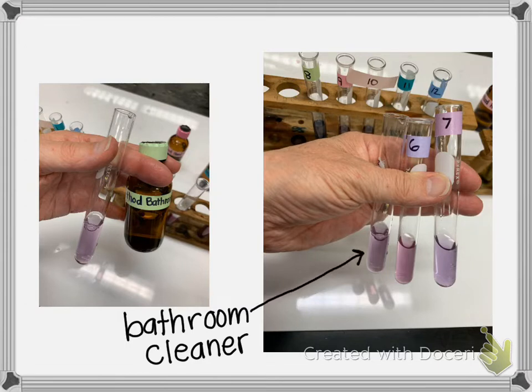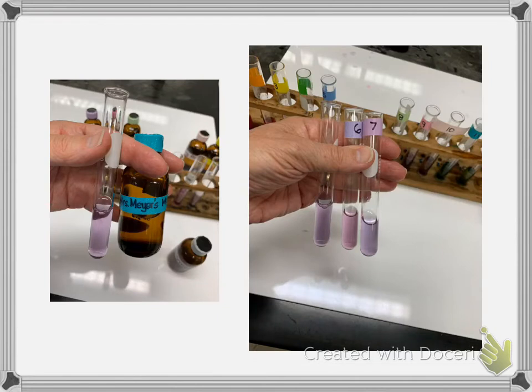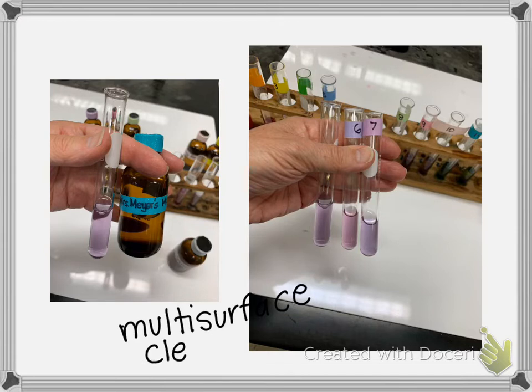So that's in this test tube, and then these are 6 and 7. Normally when I have time to prepare for this and I'm not in a hurry, we'll do things like carbonated drinks and stuff. This is a multi-surface cleaner. Looks like it's Mrs. Meyer brand. I'm a little surprised how neutral all of these are, all hovering around 5, 6, 7. Oftentimes soaps themselves are basic, but there's the 6 and 7.